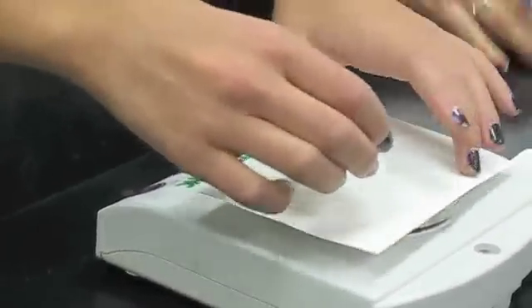The purpose of this lab is to measure the transfer of energy between water and wax of the candle. In doing this, we are going to help you understand the concepts of heat of combustion and the molar heat of combustion, which also means the amount of energy released in the reaction and how much energy it took to allow that. Measure the mass of the candle.